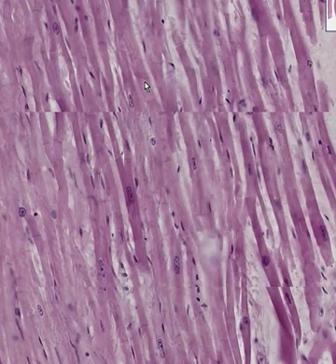So there we are, all three types of muscle on one nice slide. And I hope that I can convince you that there's no possible way you could ever confuse striated skeletal from cardiac muscle for the rest of your life.